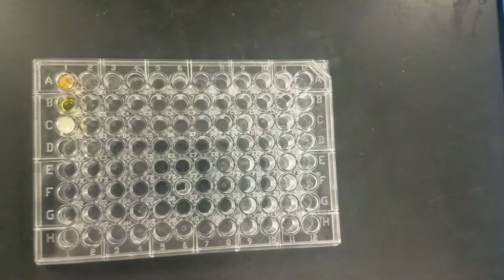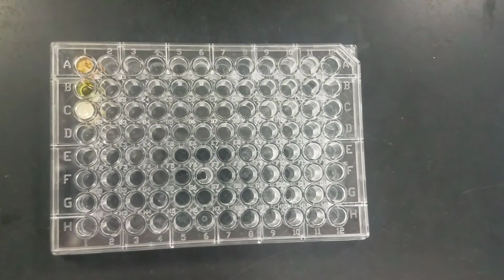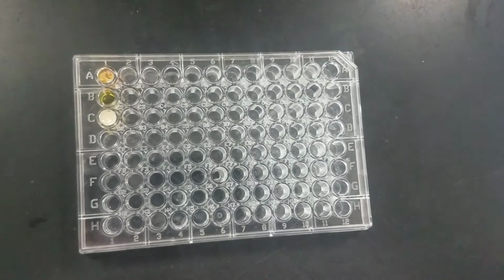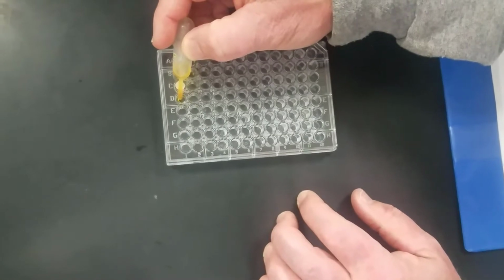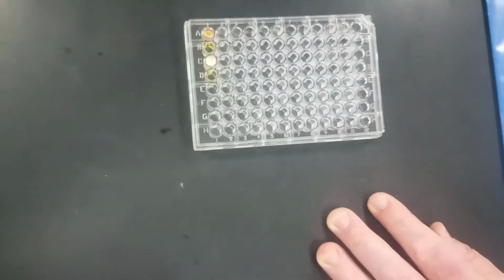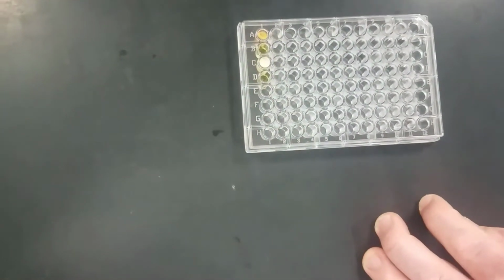So actually that was number 4 in your lab book. So I'm going to go back to number 3, and number 3 is, again, iron chloride. So this is number 3 on your lab report. So 2 drops of the iron chloride, and now I'm going to be using sodium hydroxide, which says number 6.